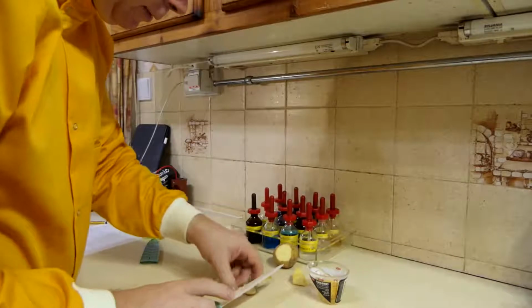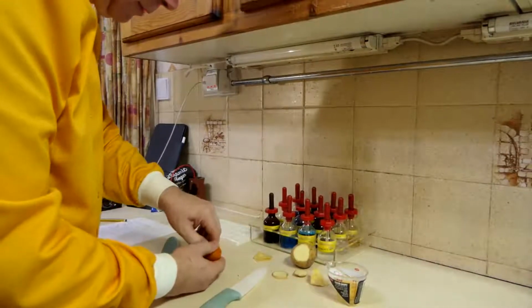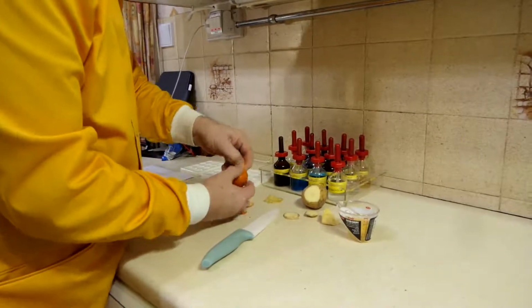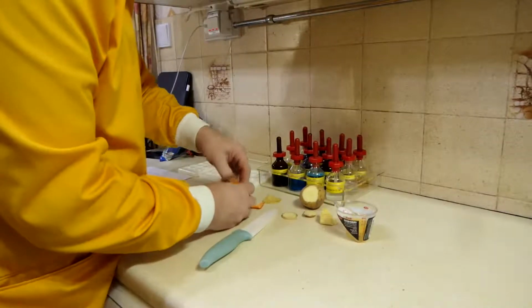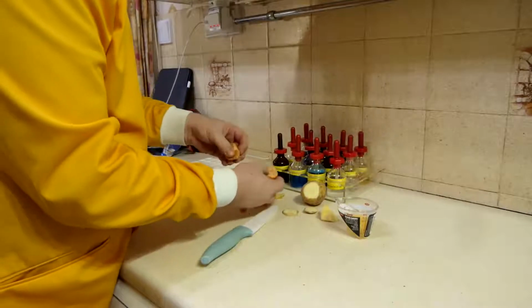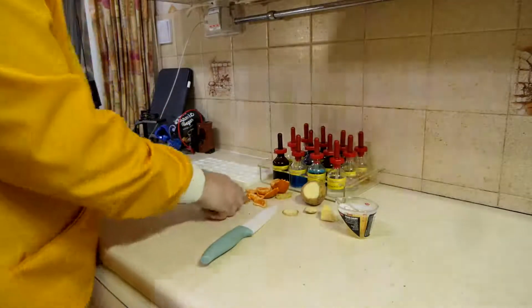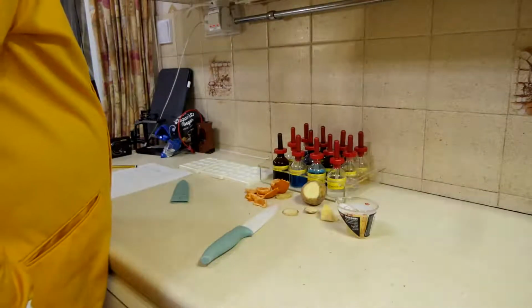I've got my slice of potato and we'll get into the satsuma. Proving more difficult than anticipated. There we are. So I probably will open that one up to start with. Okay, so we're ready to try and start this.